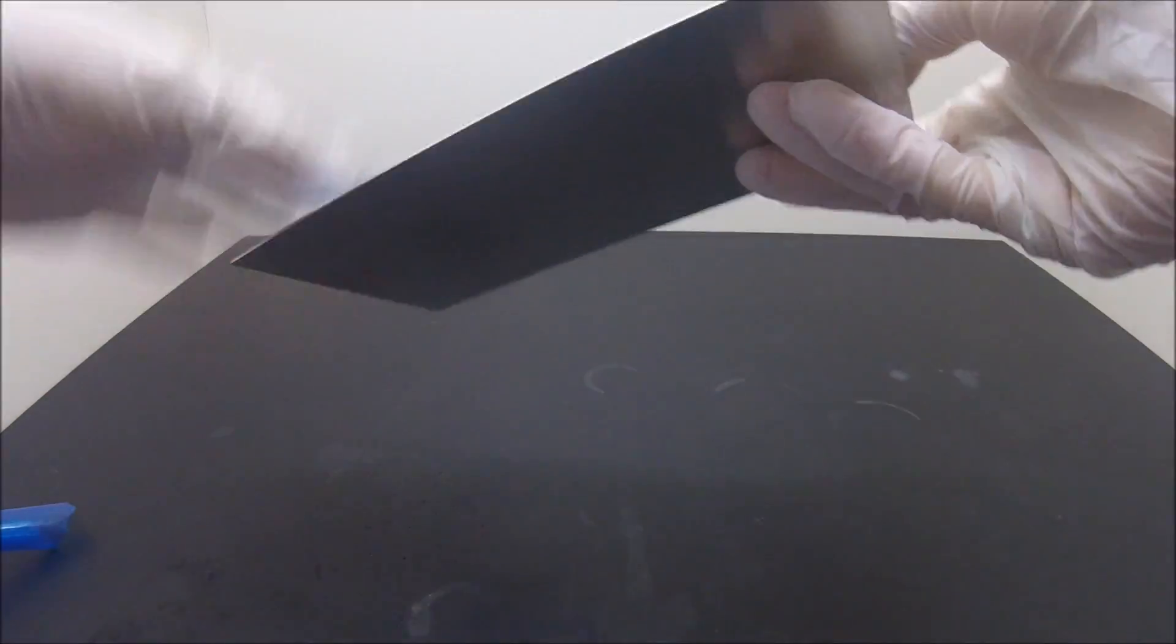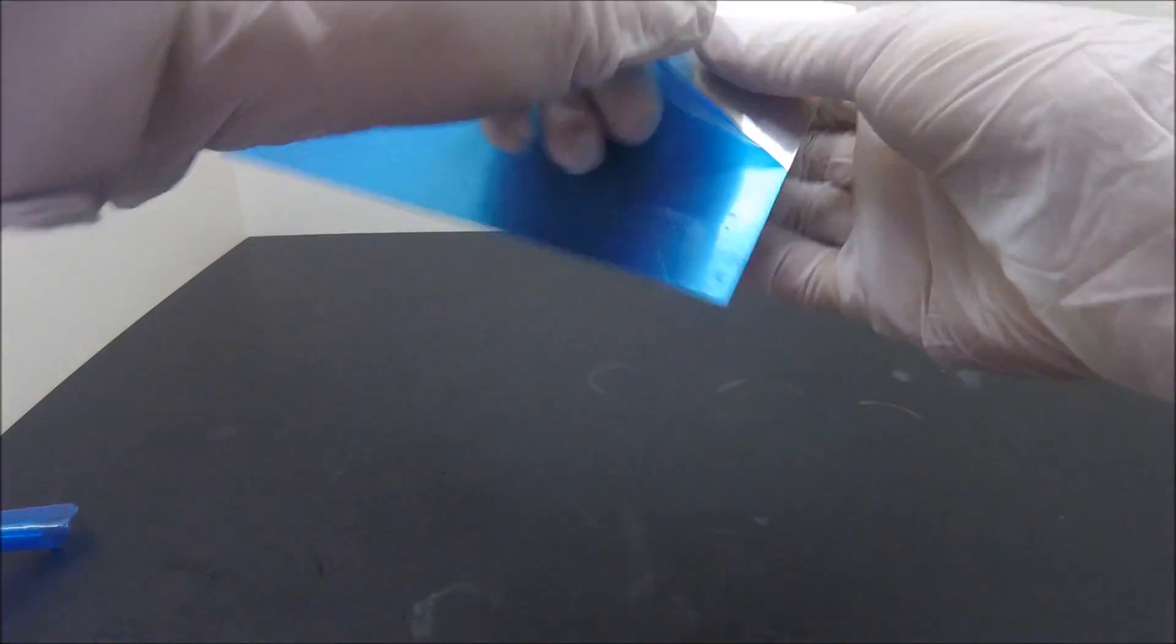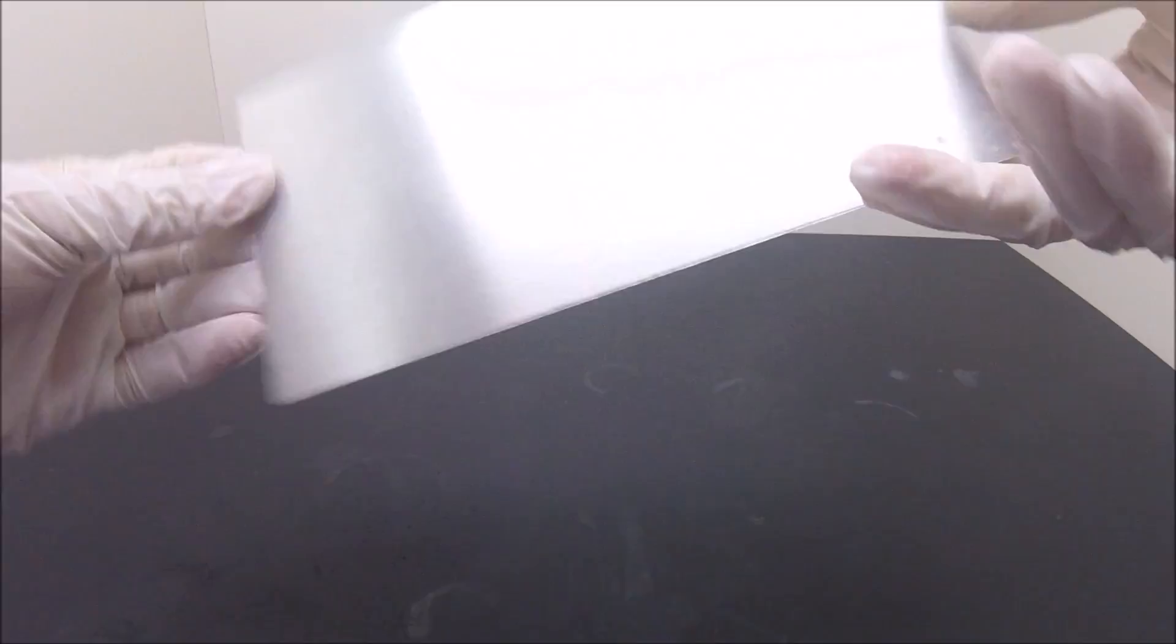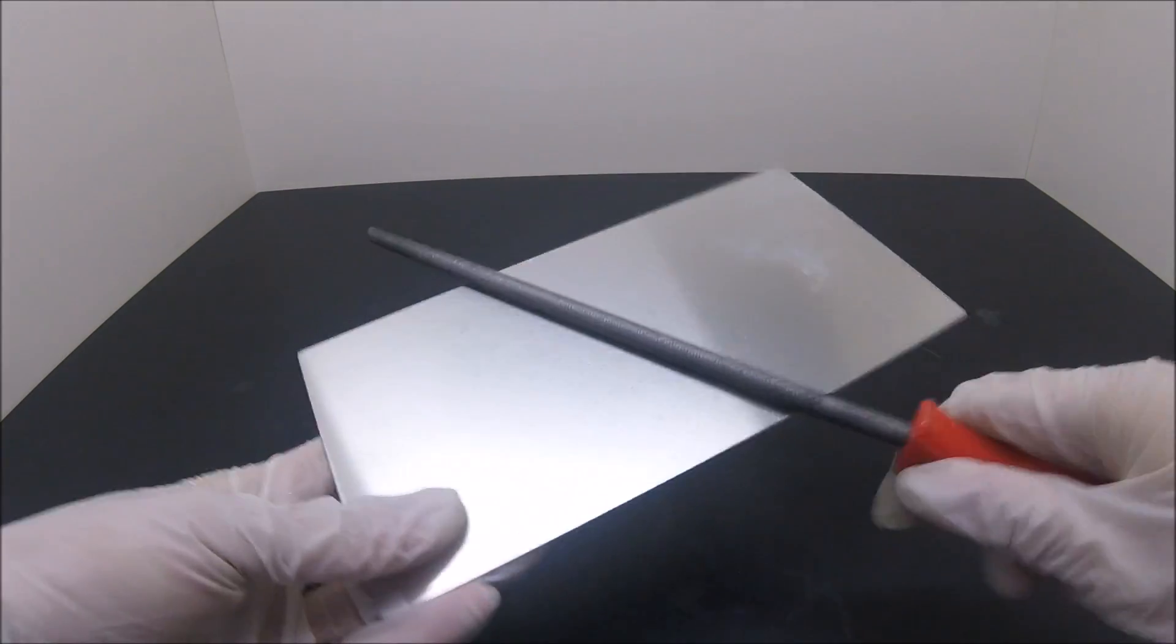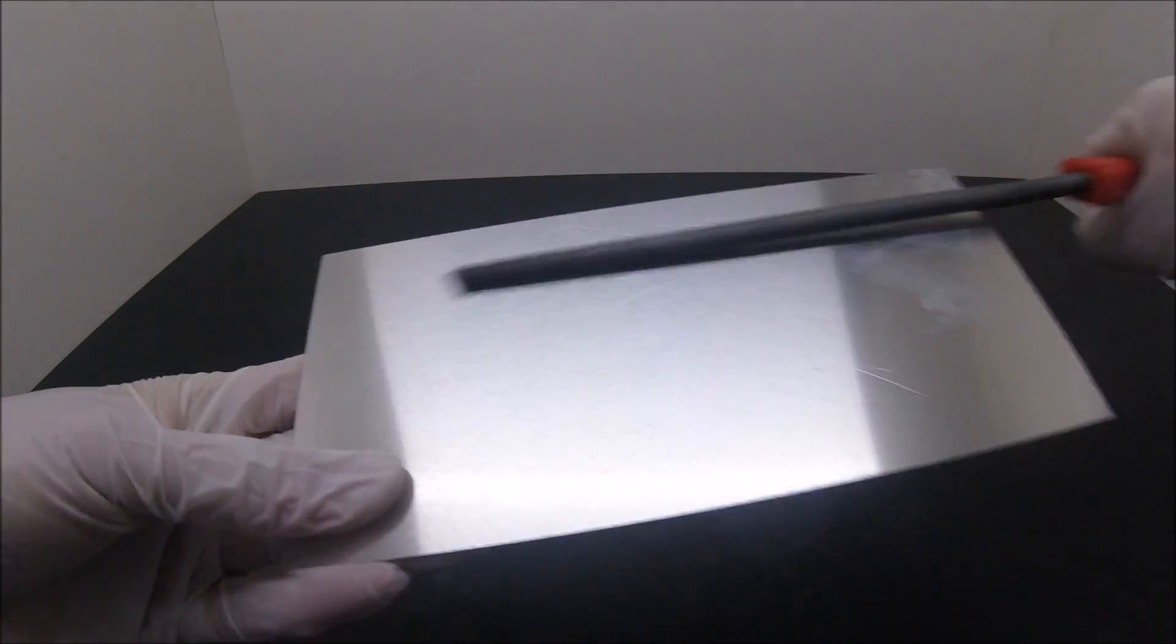Here I have an aluminum plate with 1 mm in its thickness. Let me just remove the cover layer real quick. In order to make it easier for the mercury to fuse into the aluminum, the oxide layer is removed with a file.